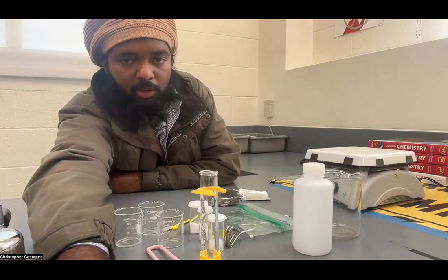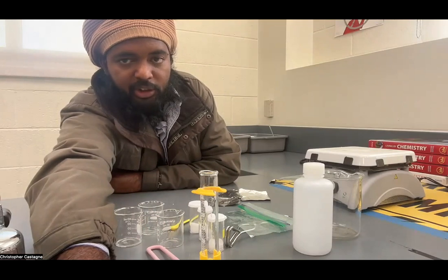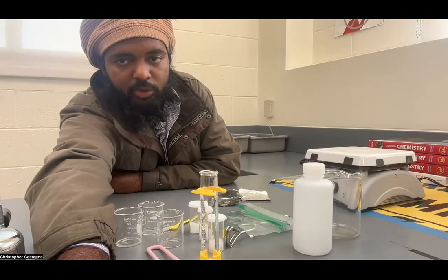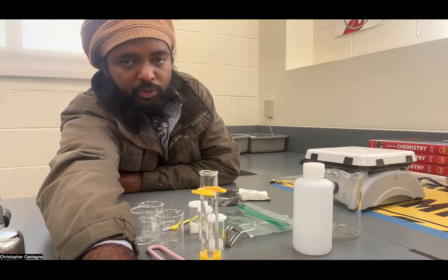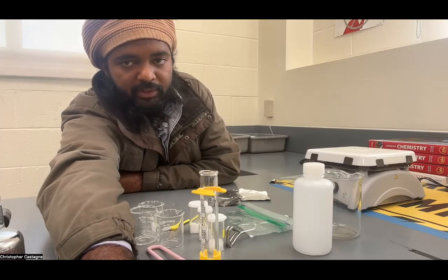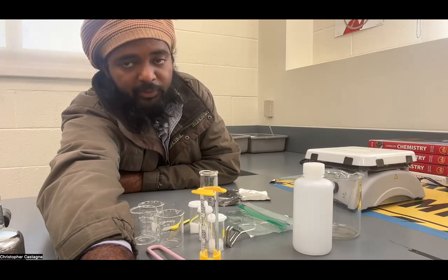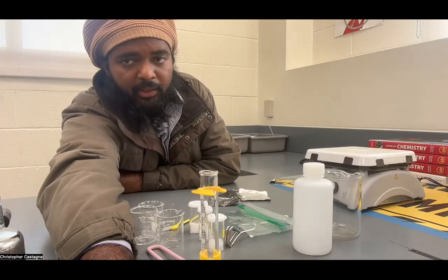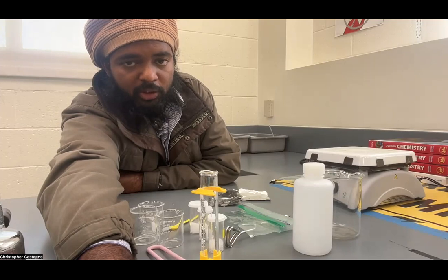I've put this into the context of an investigation where there's been a break-in in a chemical lab and two chemicals have been stolen. We have three suspects and each suspect has two chemicals, but a different two. In all, we have three chemicals. The objective is to identify the culprit by identifying the substances, because we've been given the formulas and the structures of the three solids — two from the lab and one that was not in the lab.